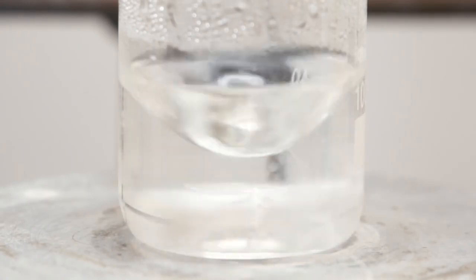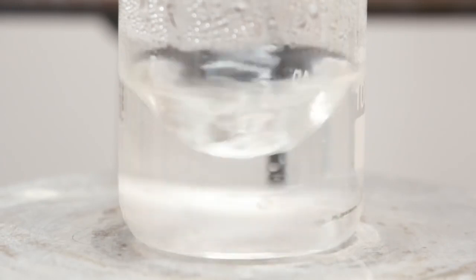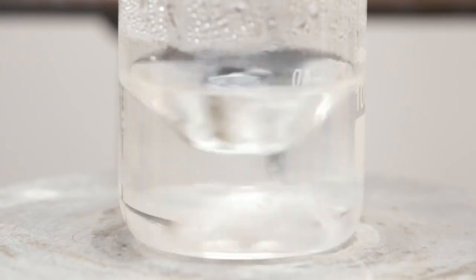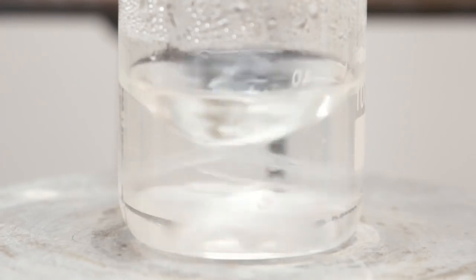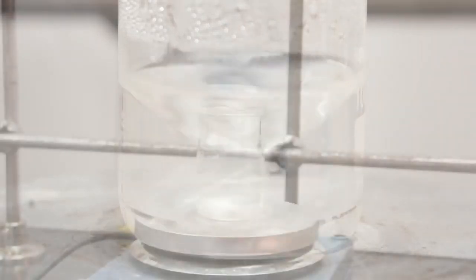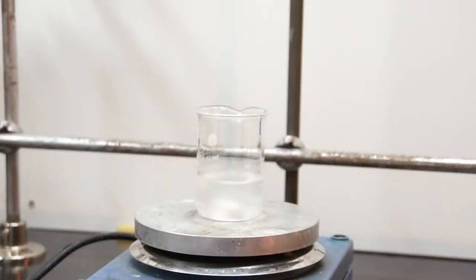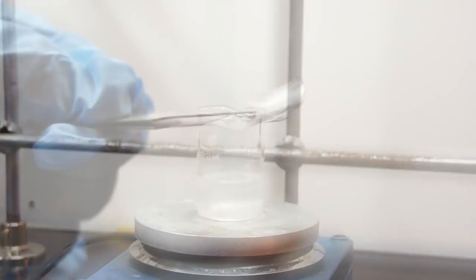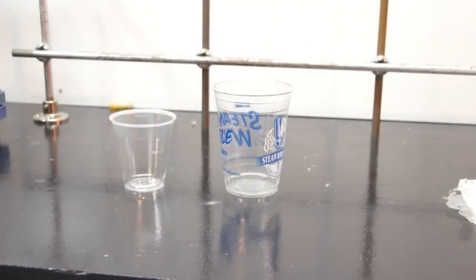Here we have a couple clippings from one of those degradable plastic cups, stirring in hot sodium hydroxide, specifically 2 molar sodium hydroxide, pH 14, at about 90 degrees Celsius for about 5 hours. And that didn't even do anything to it. And then I gave up heating and left it stirring for about a week. And even after a week of stirring, it still looks exactly the same. There's basically no degradation other than a little bit of warping and swelling of the plastic. Again, these cups are rated to degrade over 2-3 years.